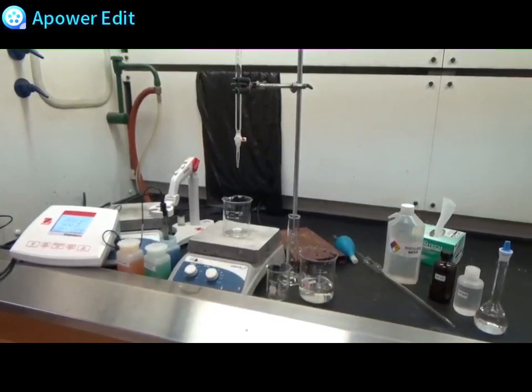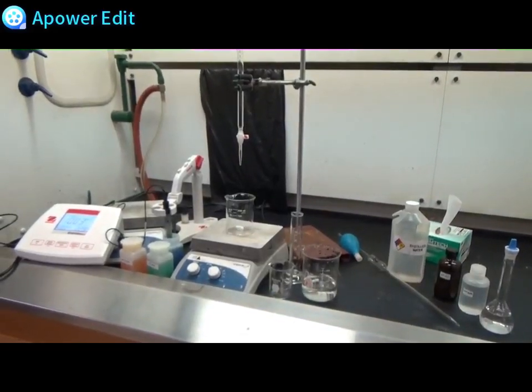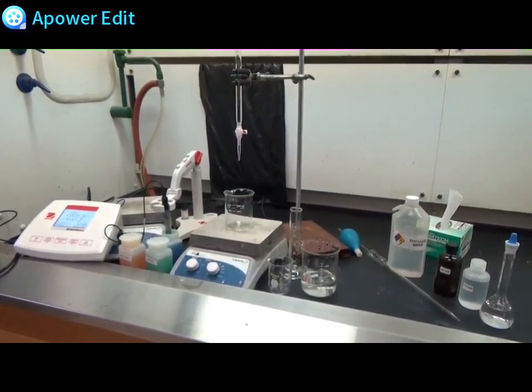Welcome to lab 3 of CHEM 207. This is the titration of an amino acid.